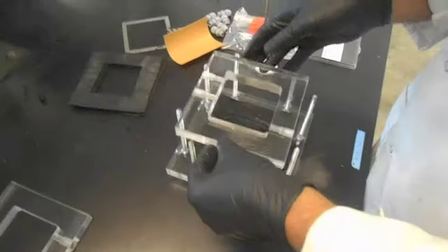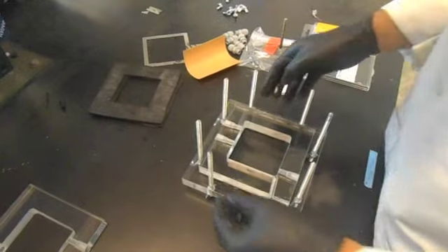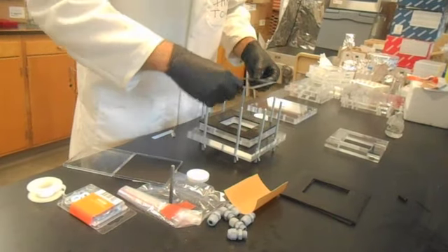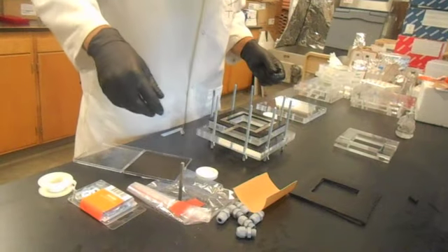Lay the cathode interior frame flush with the rubber to minimize potential sources of leaks. Coat another rubber with silicone grease and lay it on top of the interior frame. Place the stainless steel current collector over the center of the rubber. We don't want the stainless steel to touch the solution because it is a good reducing agent and may corrode over time.